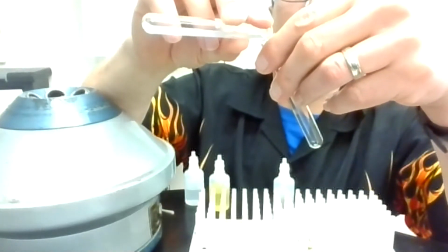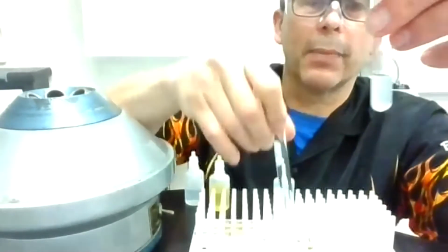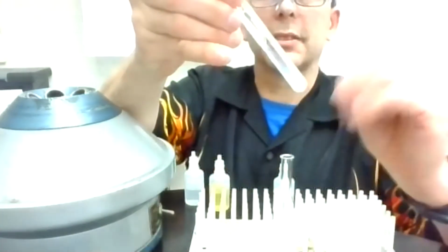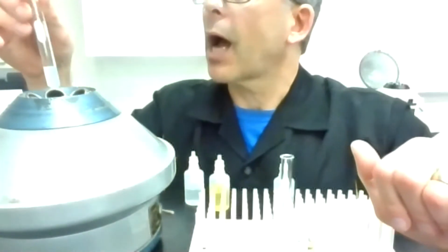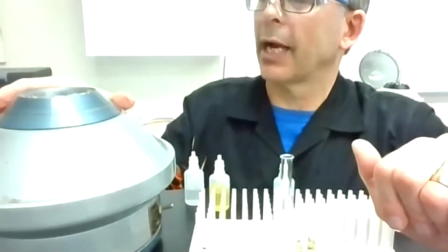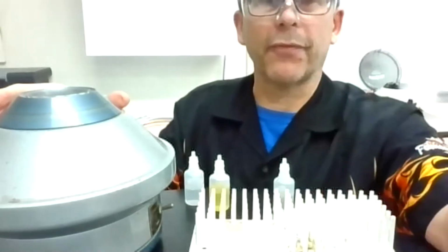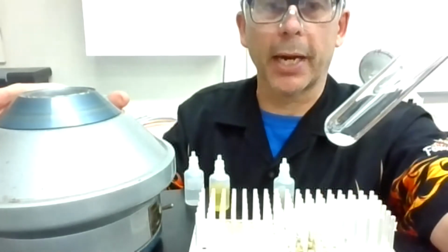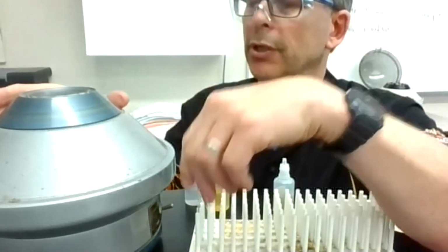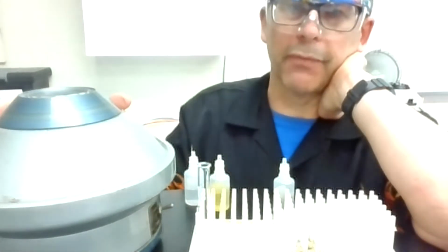Okay, so that's the solution, but it seems like it's still got a little bit of this left over. There's a solid at the bottom. I might give it one more zip, and I'm going to take out the solid I got, see if I can get anything else out. I can still go to the next test like this, but it's nicer to have a little bit of a cleaner backdrop right there. So there's definitely some solid at the bottom that I got from that step. And I'm just doing a recentrifuge and see if I can get any of that extra stuff out there.